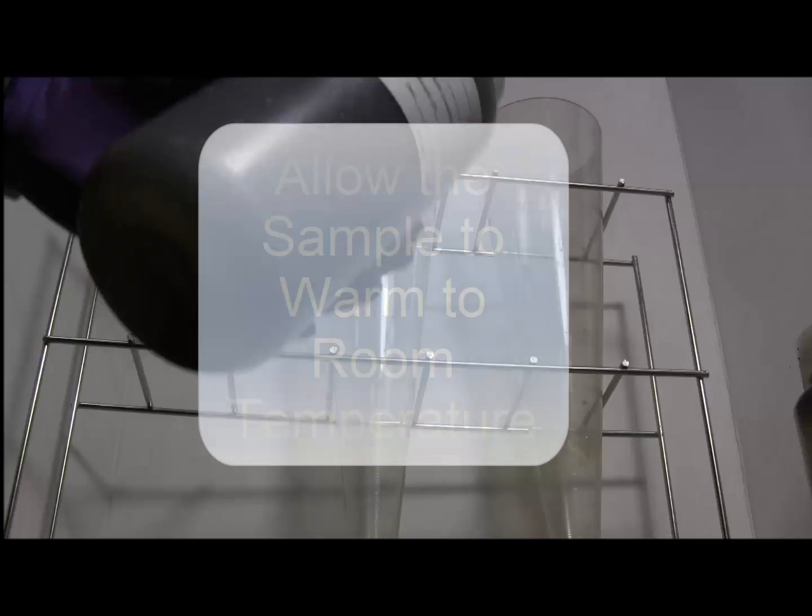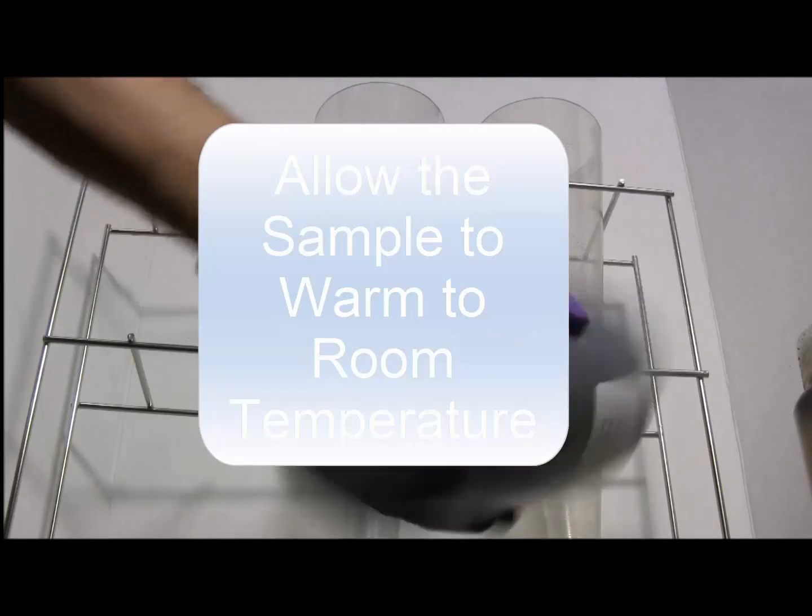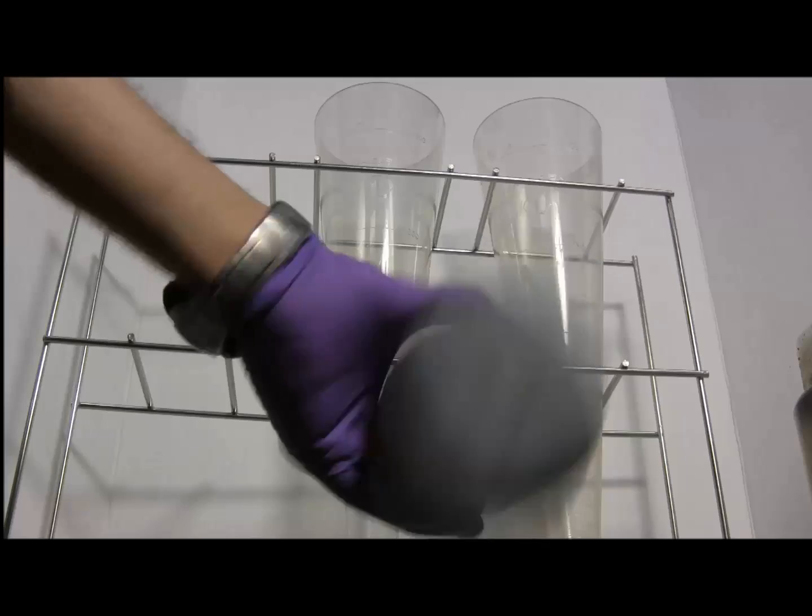Your sample should have been stored at or below 6 degrees, so you'll need to allow it to warm up.